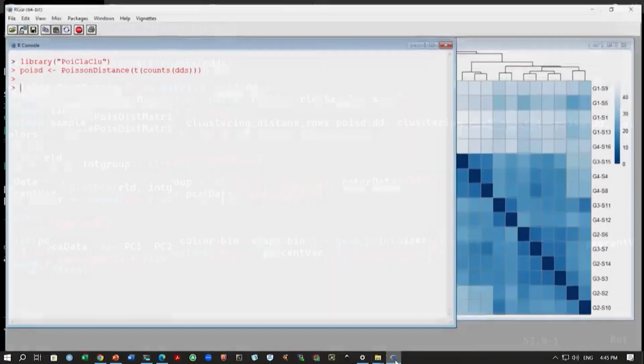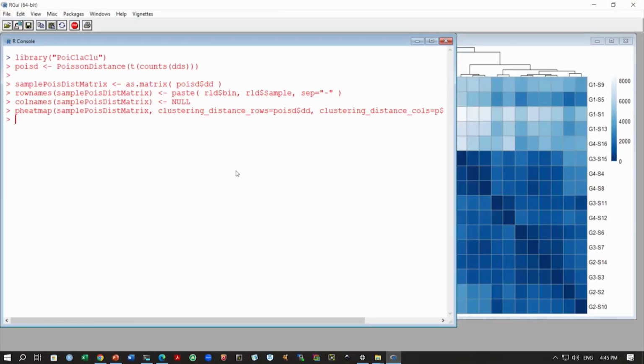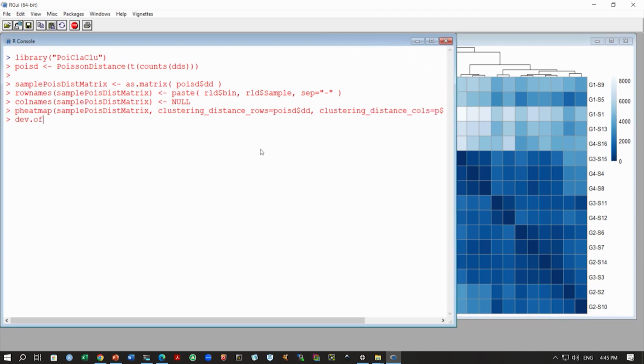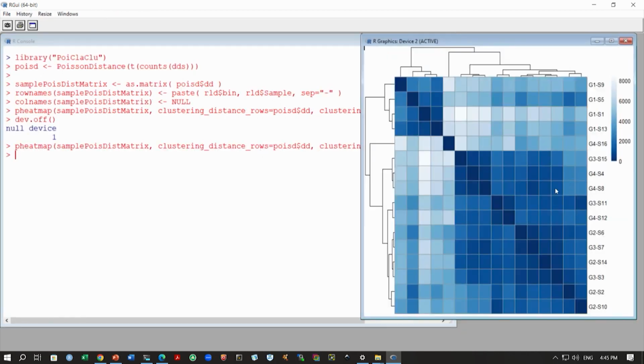I will run this, and then I will generate this plot. You can see there is a bit of difference. I will close this, and then I will generate it fresh, and you can see this data now. This is slightly different from before, and again we have the group names and the sample names.